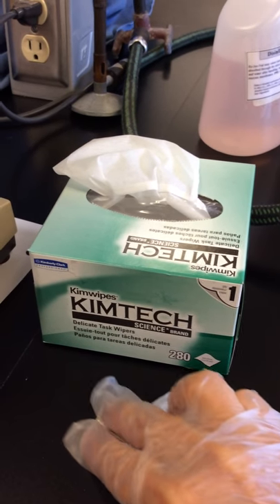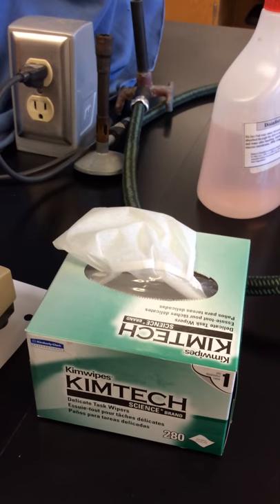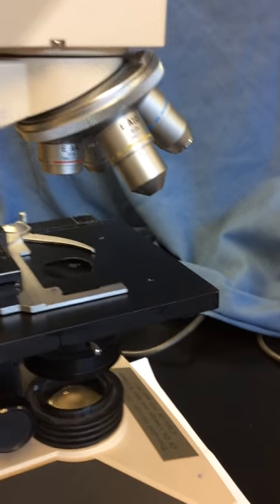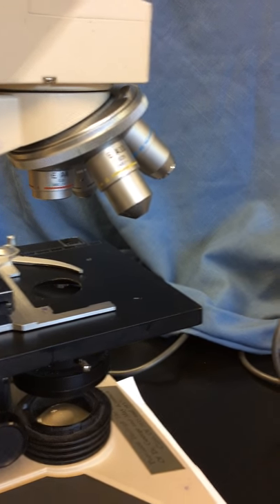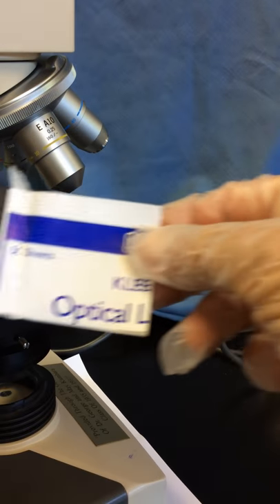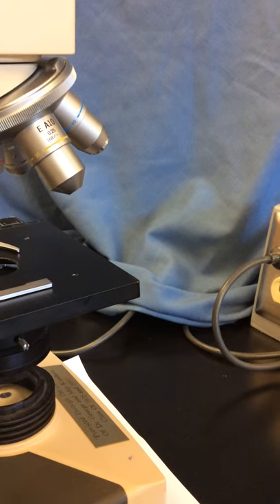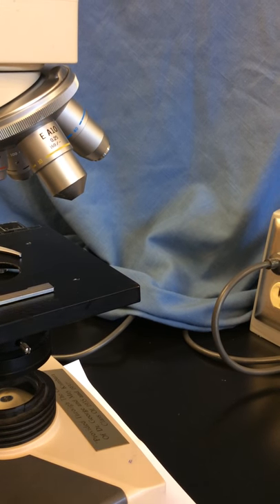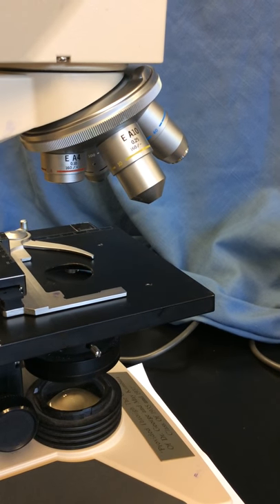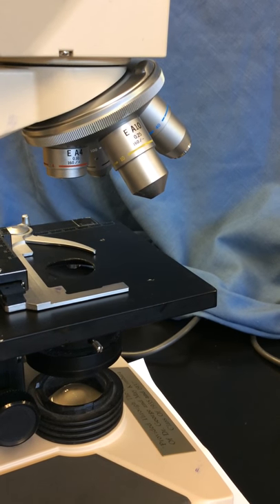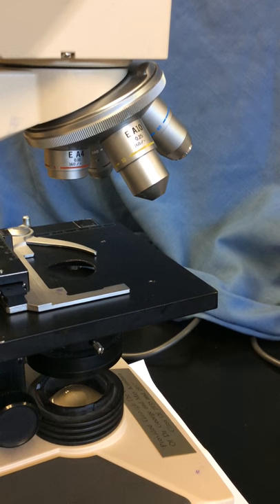Next, we're going to make sure that we clean our microscope lenses. For cleaning the microscope lenses, remember, we only use high quality lens paper. We aren't going to use chem wipes, nor Kleenex, nor paper towels. Anything other than lens paper will scratch the coating on the lenses and potentially could destroy the lens. So don't be afraid to use multiple pieces of lens paper.